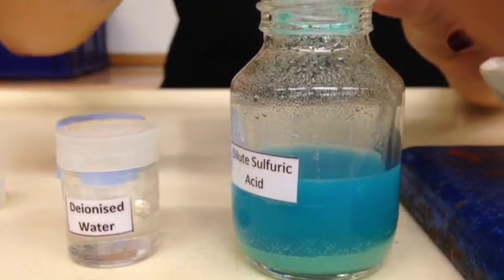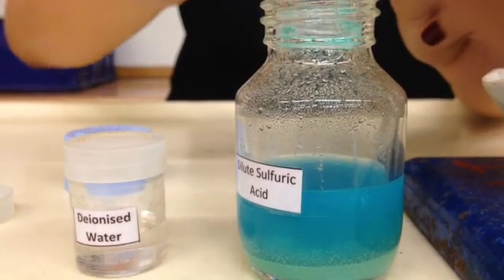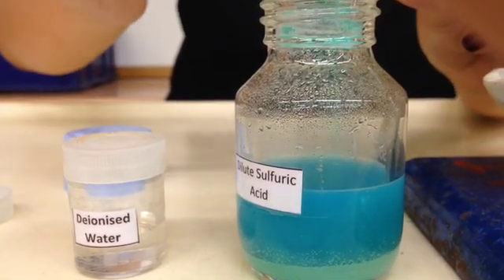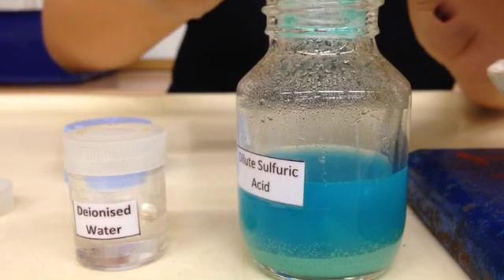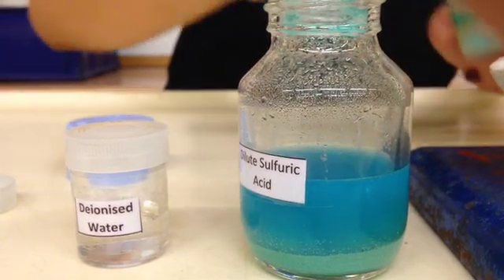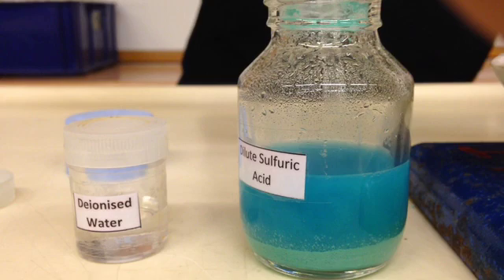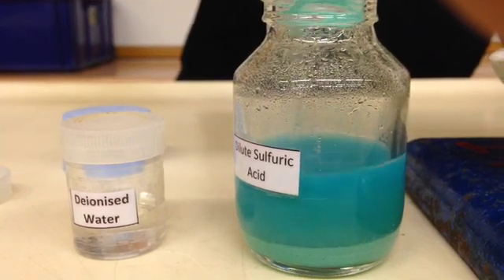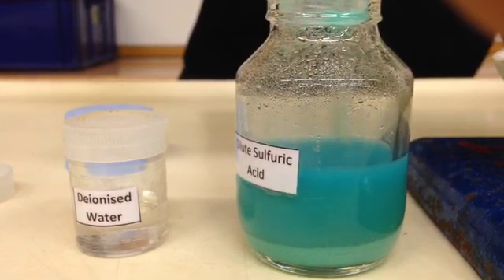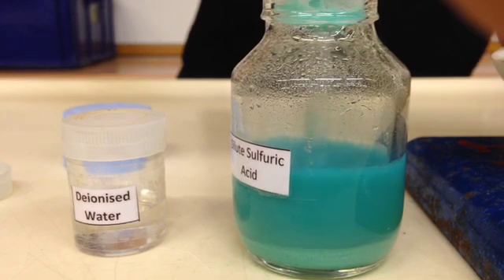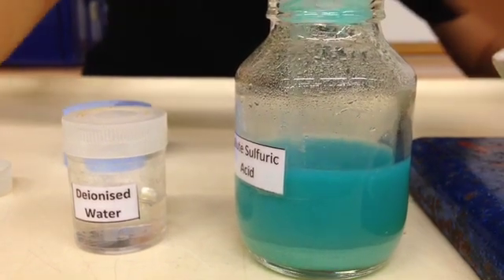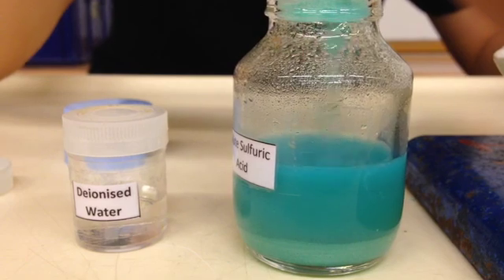It's okay for you to add more of the copper 2 carbonate because remember that we want it in excess, so you just have to make sure that we add in until after all the effervescence has stopped, you can still see some green color powder at the bottom and this is all the excess, the leftover copper 2 carbonate powder.